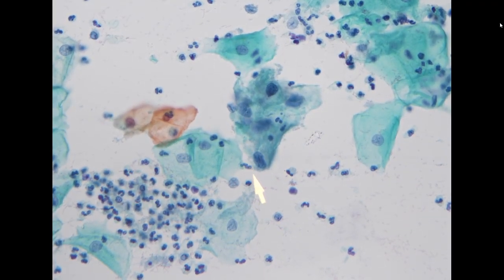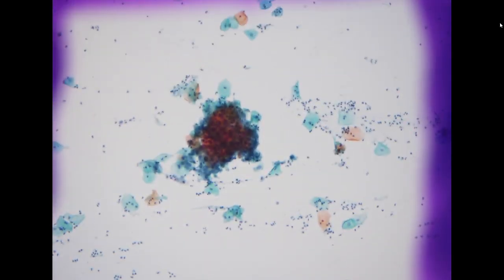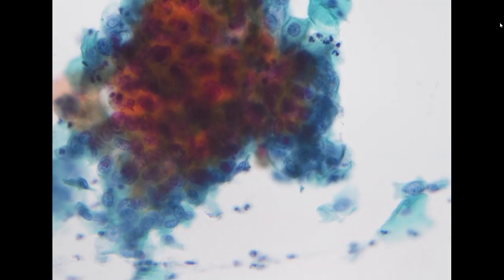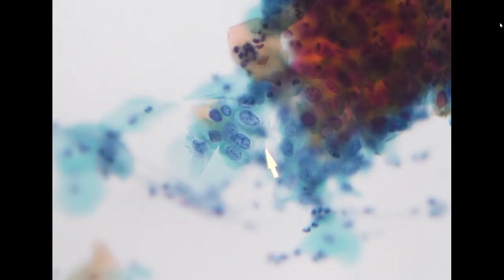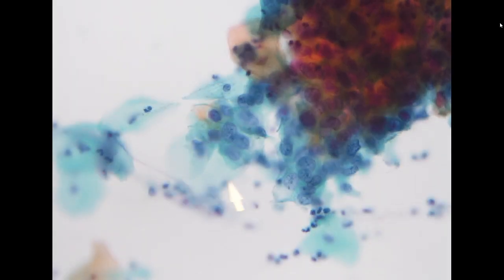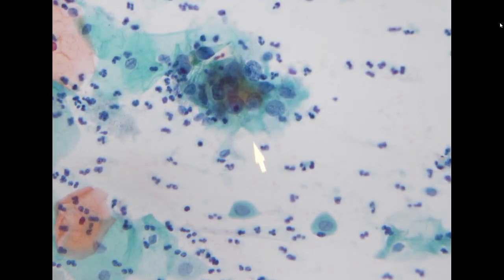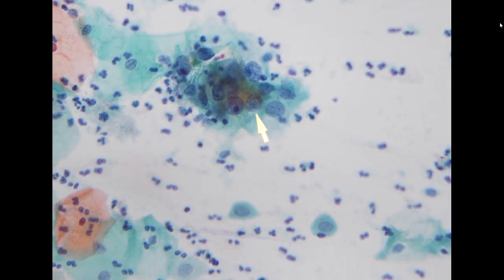So overall, you see some atypical cells, but it's a little bit difficult to call it frank dysplasia, like a CIN lesion. And here you see an even tighter cluster, which makes it a little difficult to appreciate the cytomorphologic features. Adjacent, you see similar features like hyperchromasia, slightly coarse chromatin, a little bit irregular nuclear membrane. So in this situation, it's probably difficult to call these dysplasia outright. So I decided it is better to call the specimen ASCUS, cannot exclude high-grade, ASC-H.